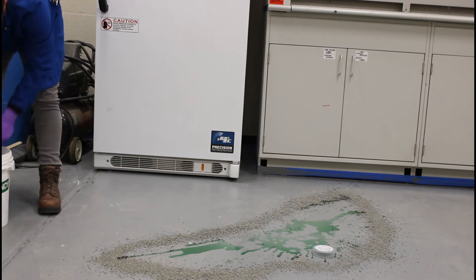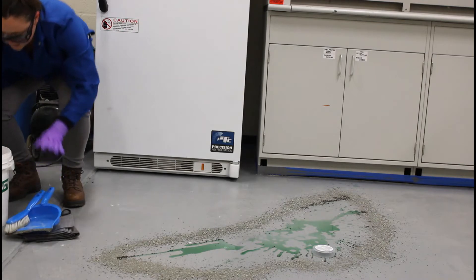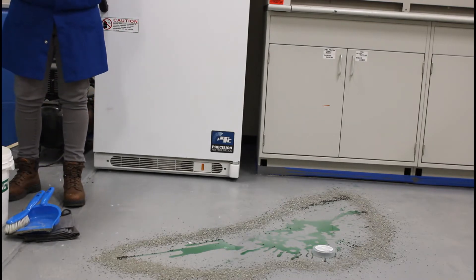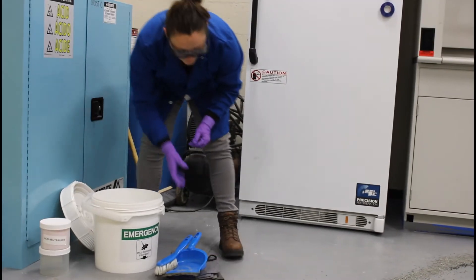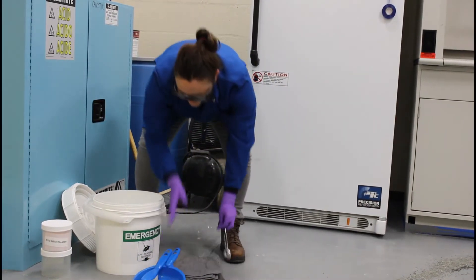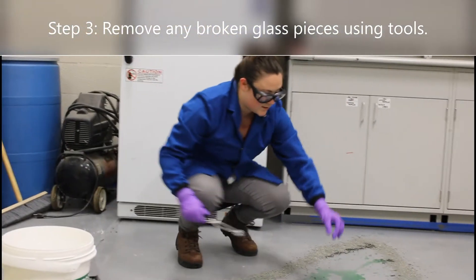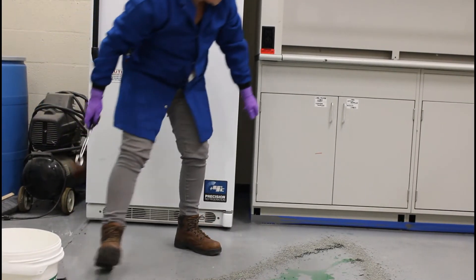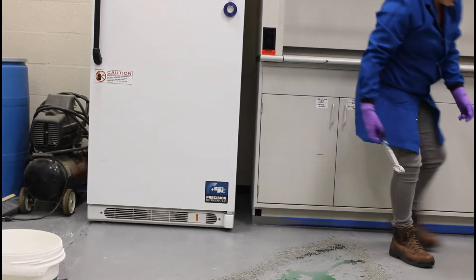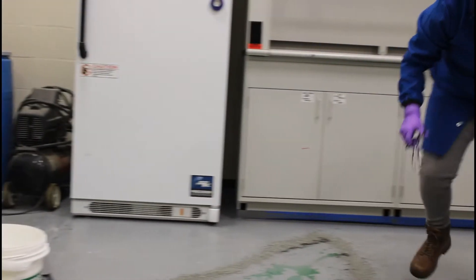If you have an acid spill, you can use an acid neutralizer provided in your spill kit. Then you want to remove any broken glass pieces that are in the spill. Place them in your bucket. If you have broken pieces, never handle them directly with your hands — always use a tool.